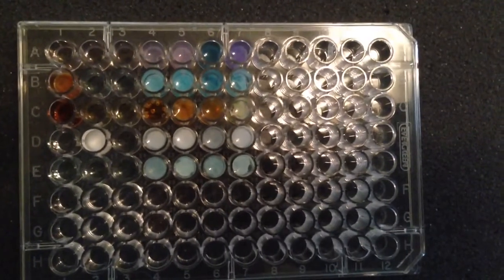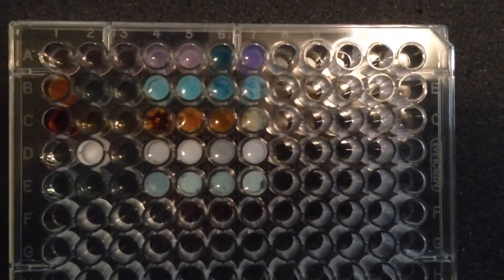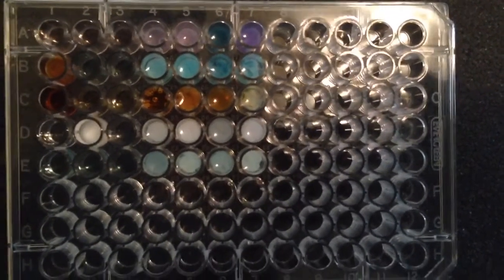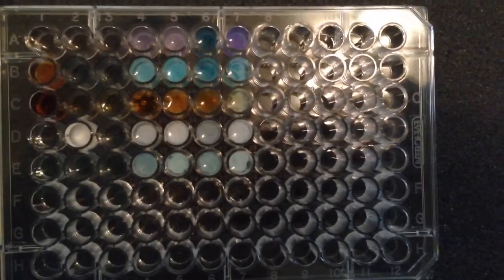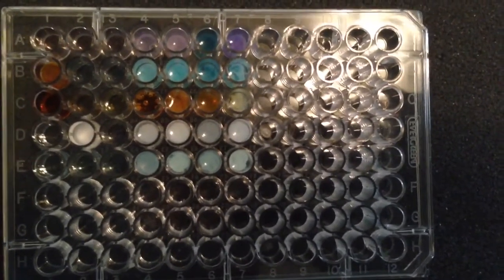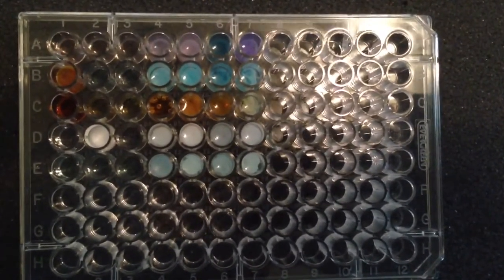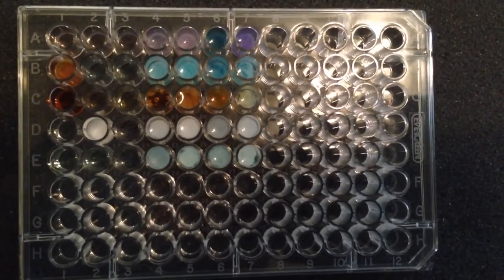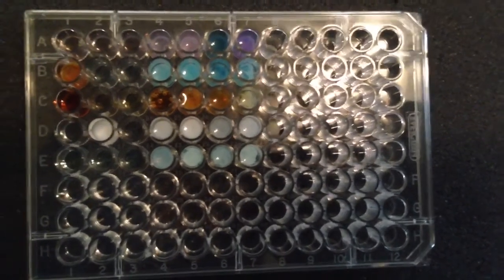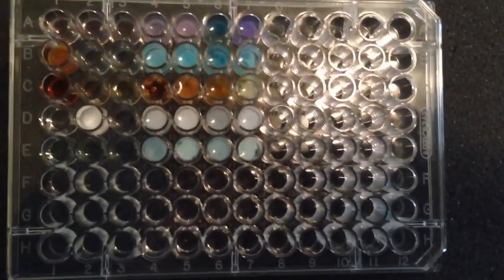So, as I was saying, this entire 4th through 7th column, if you're seeing what I'm seeing, was completely reactive. The 3rd column is a pretty good indication of what color these all started out as, if you could have seen that before I got everything going. So I am going to record all these results and put them in the data table, and the full procedure conclusions will be available with the written lab report.